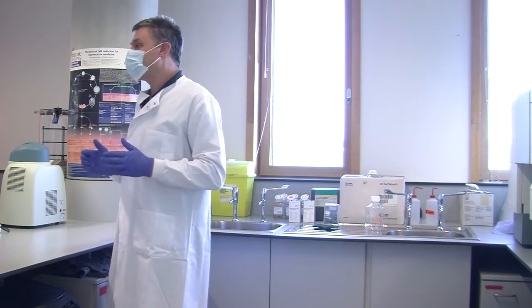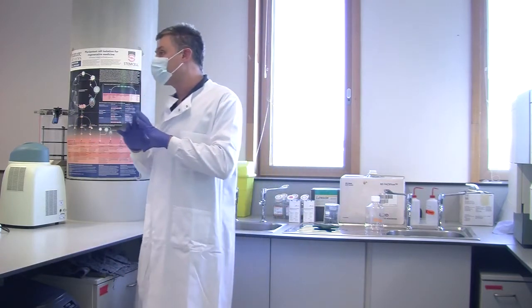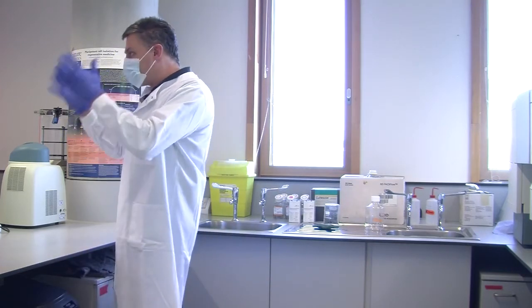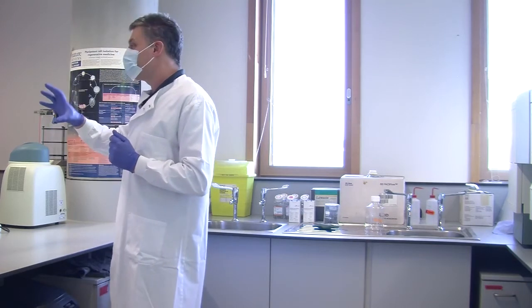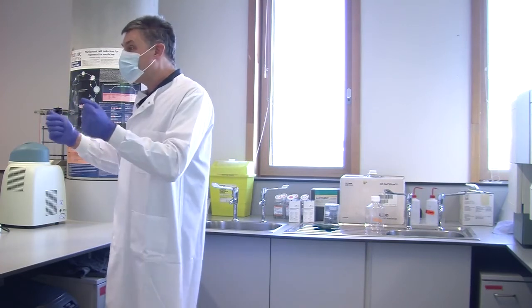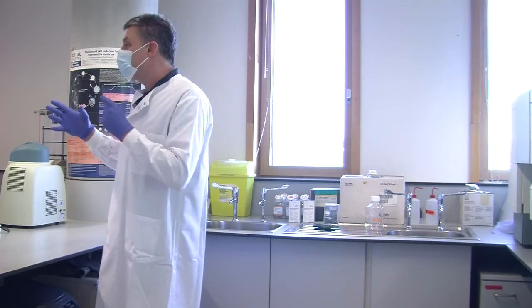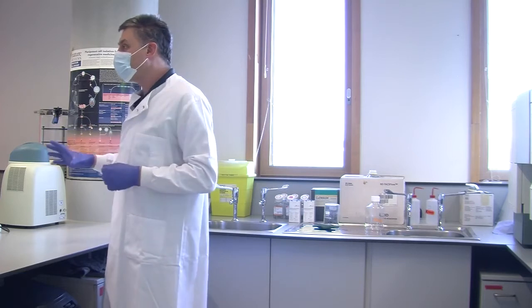The human brain is much better. Flow cytometry, when it comes to data, is very much a pattern recognition thing. So your brain looks at it. It's like those magic eye pictures where you look at it and you see a tiger, or you don't. In a way, it's the same with flow cytometry. If I look at the data, I can see the tiger there that says it's wrong. And my brain may not even know what specific things are wrong about it. It'll just say that's not right.